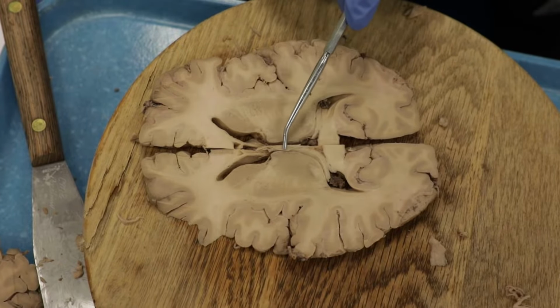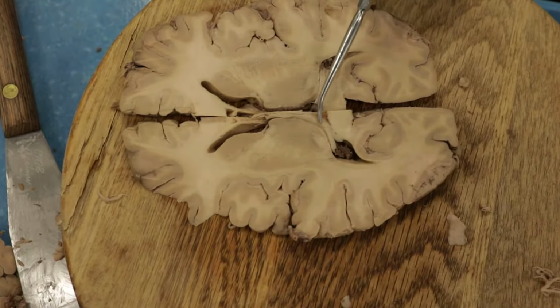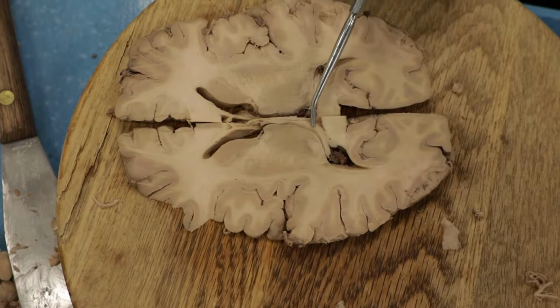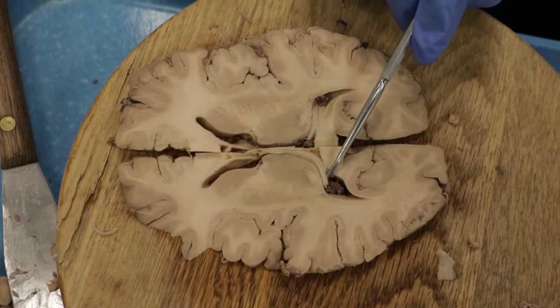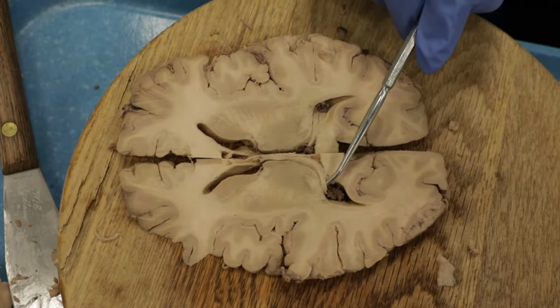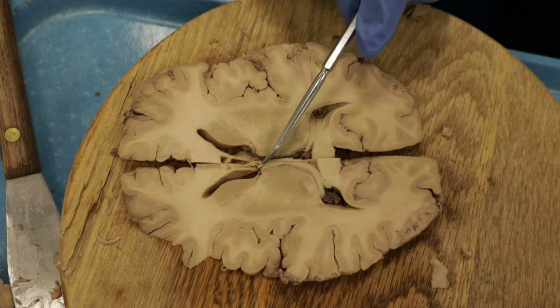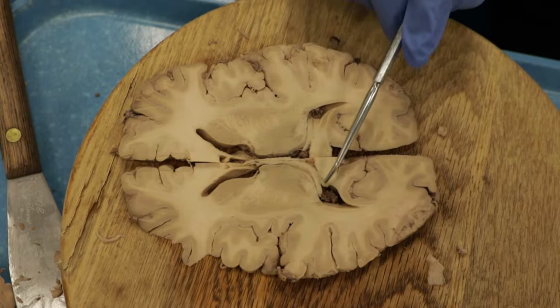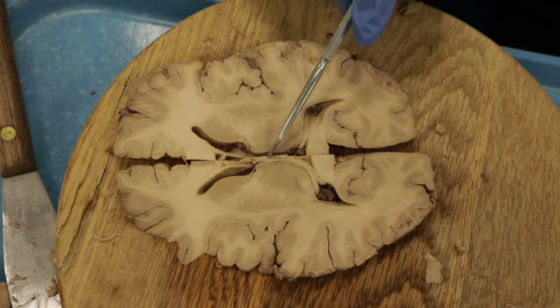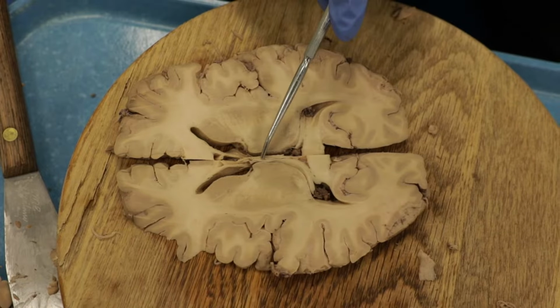Okay, this pathway right here, we can kind of see this from lateral to medial. These are the columns of the fornix. Remember, this is part of Papez circuit. This part of the fornix is taking information from the hippocampus, which we will see in our next section, and it's taking that medially to the mammillary bodies. And so here we can see how the fornix goes from lateral to medial. This pathway would be important for memory circuits, laying down new information.